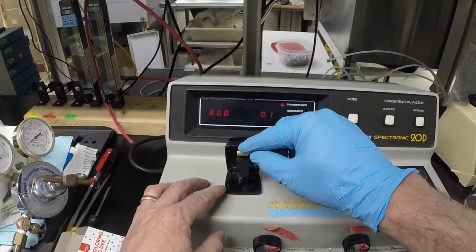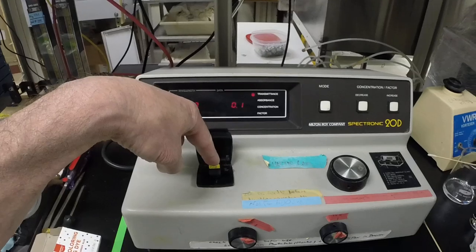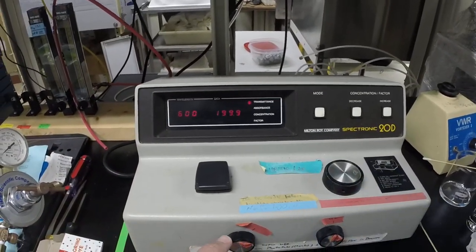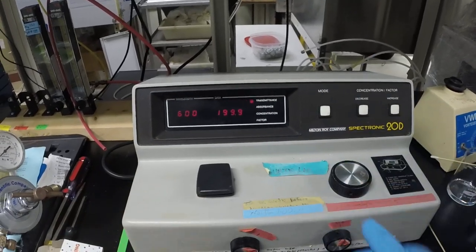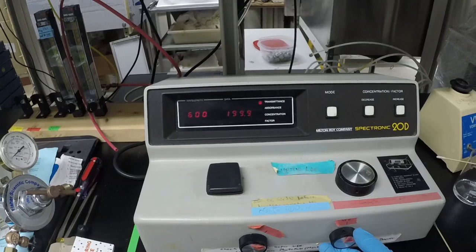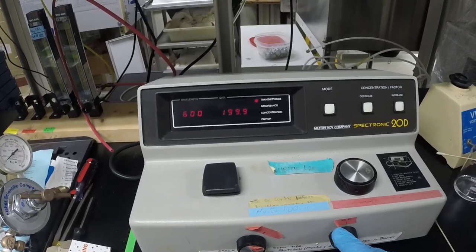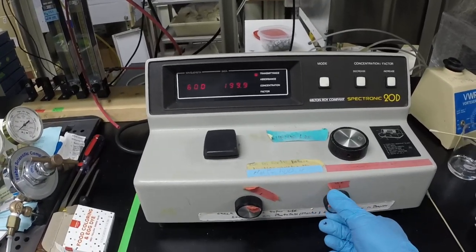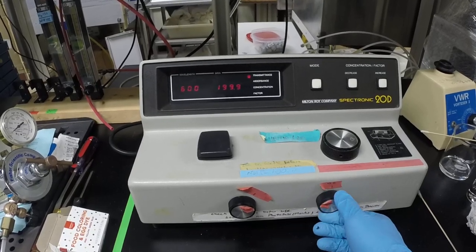So I'm placing that in here. What that does is it actually hits a little lever on the bottom, and that lever then actually opens the window. You can see that it oversaturates it, and so we need to turn this actually way down in order to get back - I forget which direction, way down or up actually, if we're spanning.